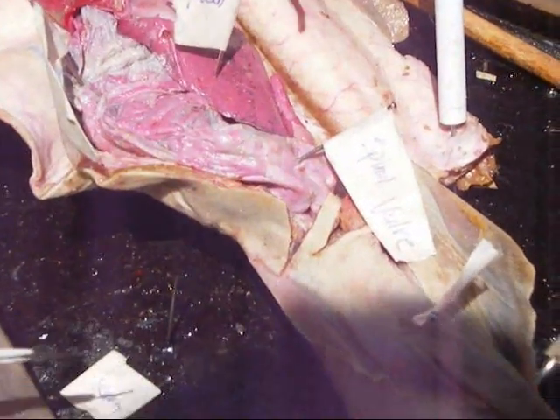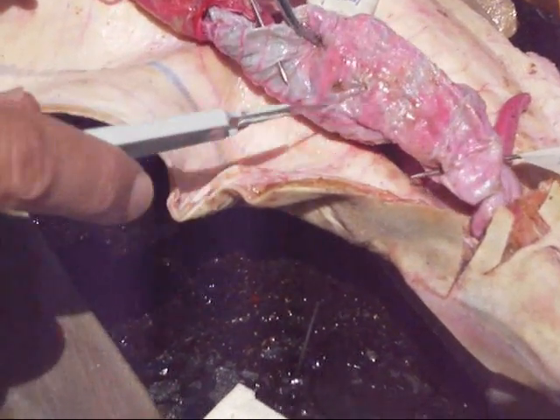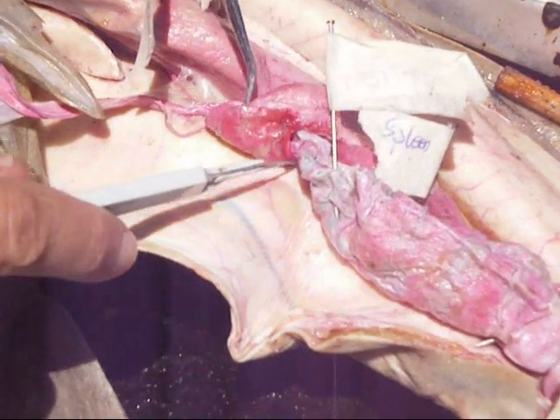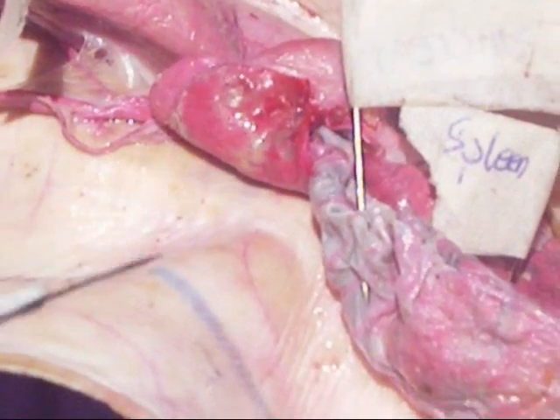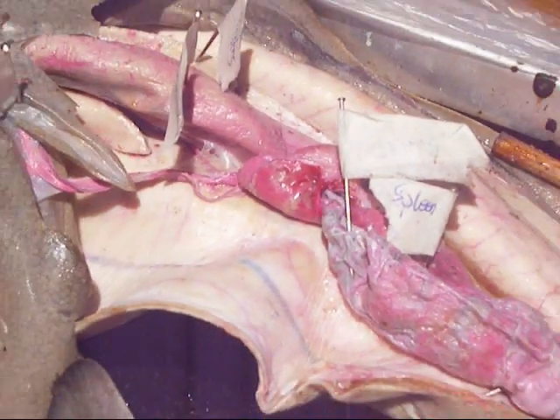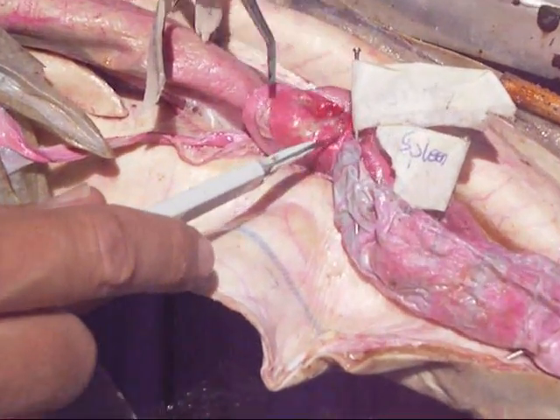So what is it? That is called the rectal gland, but I don't think that's on your list. So where's the kidney? I'll show you. The pancreas is right here — a white thing. Your shark's pancreas is not as good because it's got all that pink paint in there. It looks cool with the paint in the vessels. Yeah, they put paint in them, like a dye.